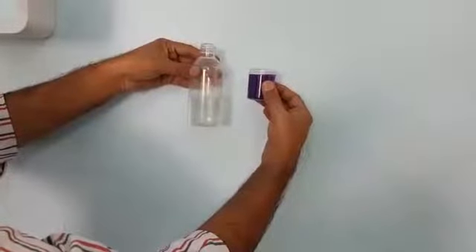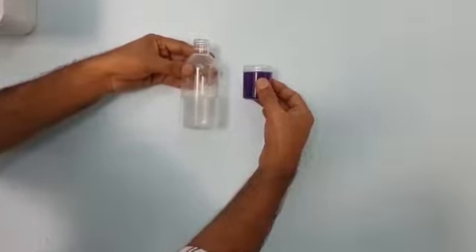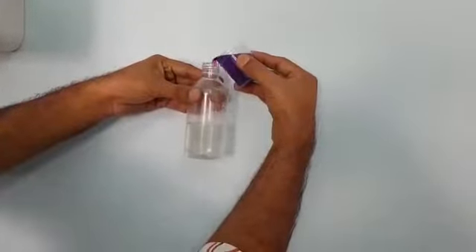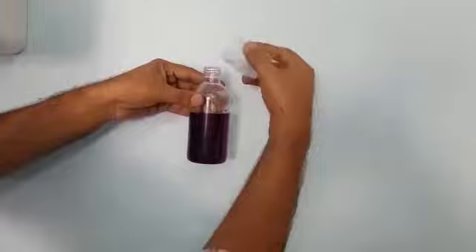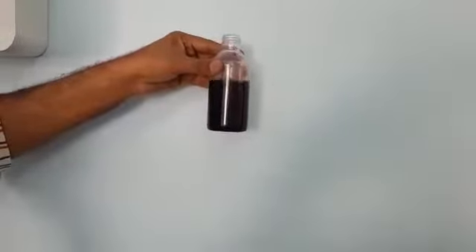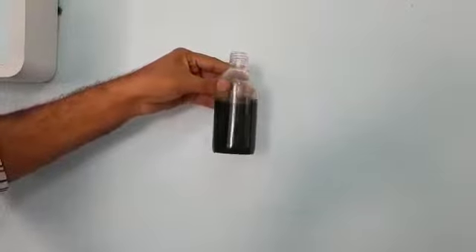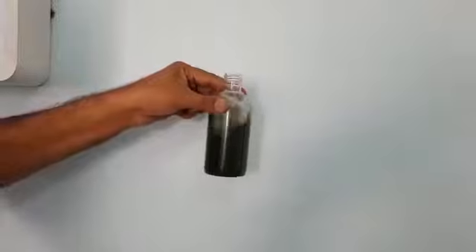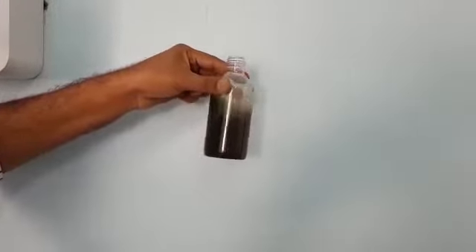And finally, for this chameleon reaction, we need to add this potassium permanganate water into this. You can see the color changes from purple to green, and then it will change to brown and then yellow.